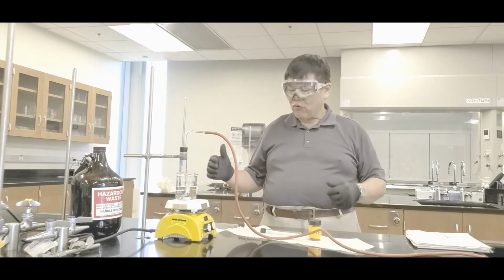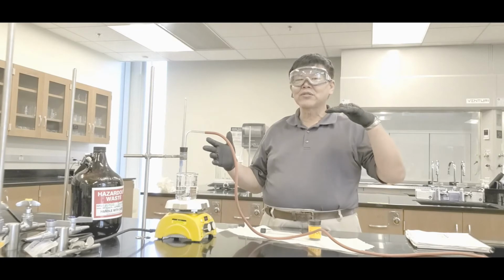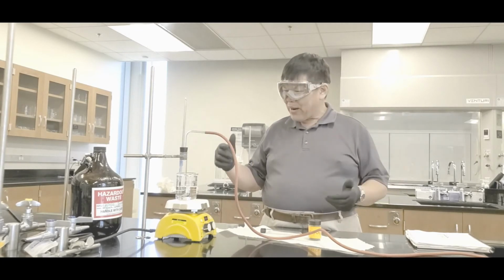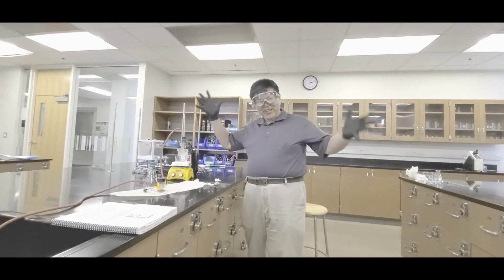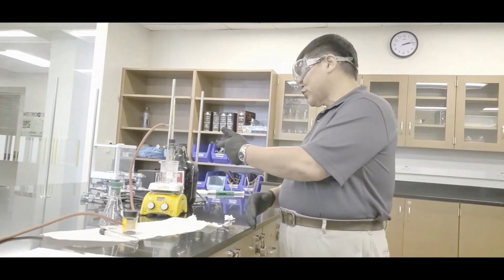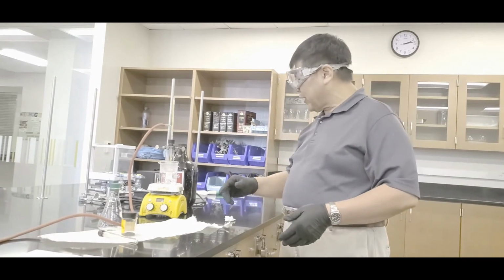Now it's going to take several minutes to boil. So what I'm going to do is this. For now, I'm going to pause the video, the time lapse, and then we'll come back when it boils and I'll show you. This was a time lapse video. I didn't want to watch you guys watch water boil. That takes forever. Now at this point, it is boiling.